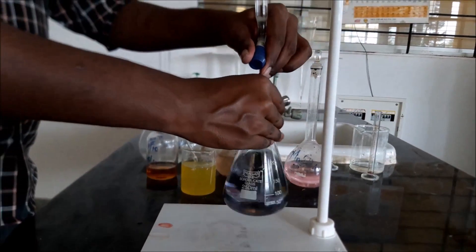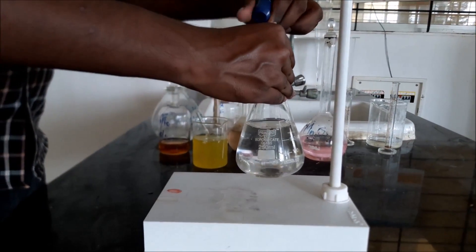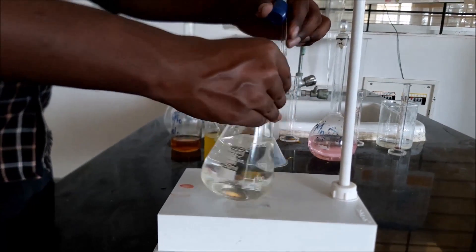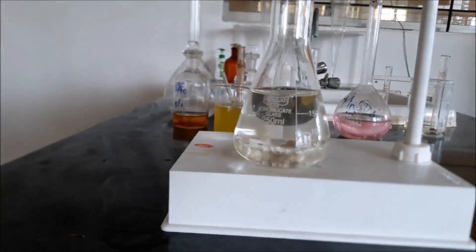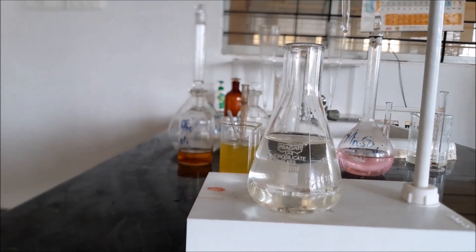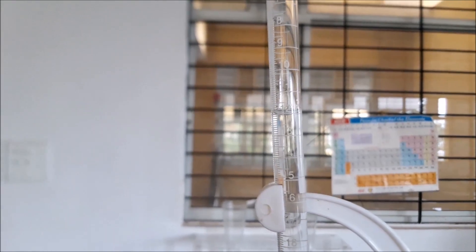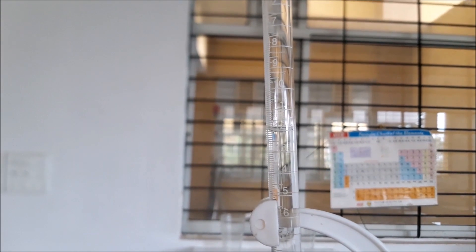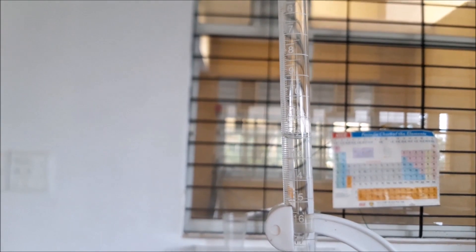You can observe that from the dark blue colour it has completely appeared to be colourless. Note down the burette reading, i.e. the volume of standard thiosulfate consumed, in order to find out the amount of dissolved oxygen present in the solution using the formula given in the lab manual.